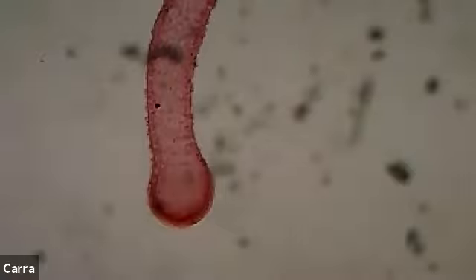Sorry, I got lost in my microscope slide. It's backwards. Okay, and then we get down to the bottom, and that's the base that's going to connect to like a rock or a substrate or something. Another really great microscope slide that I have for this is called obelia. And obelia is another great example of a hydra type form.